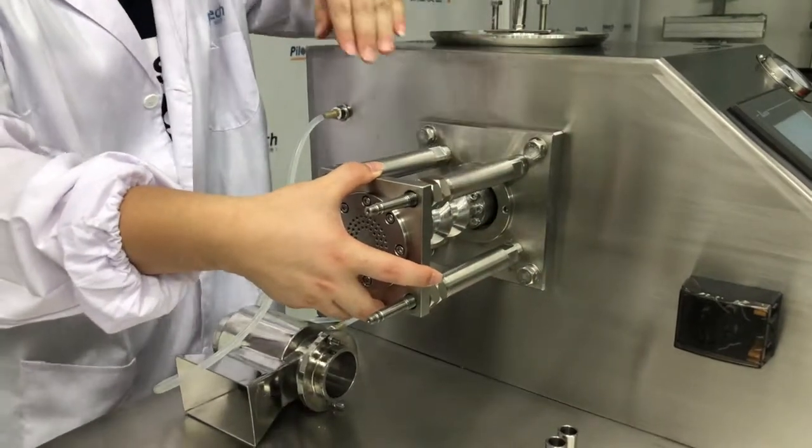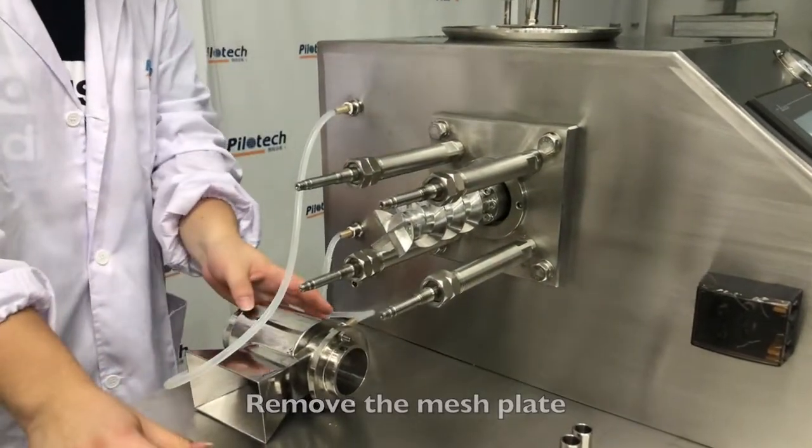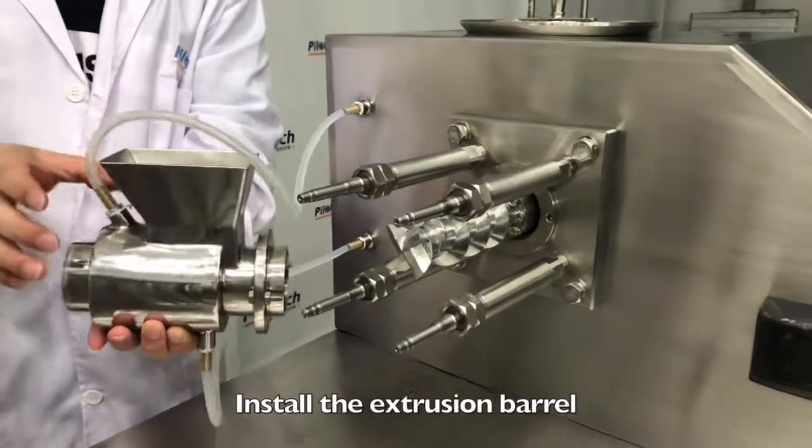Calibration is complete. Remove the mesh plate. Install the extrusion barrel.